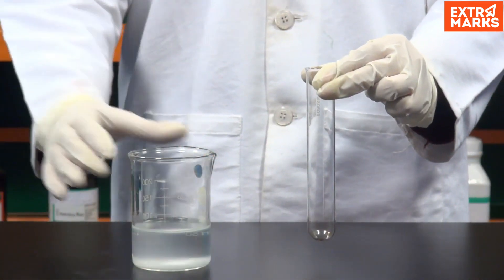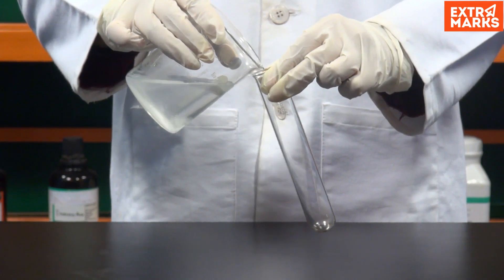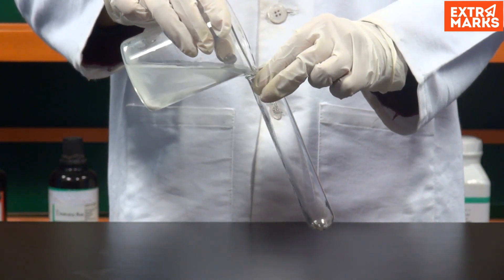Now take a small amount of clear solution of lime water from the beaker into a test tube.